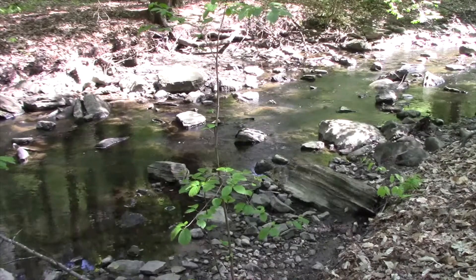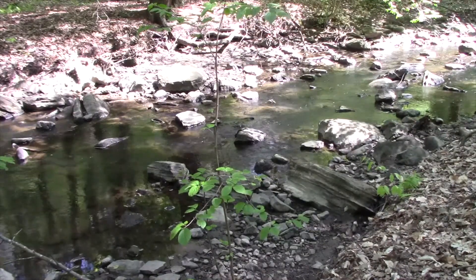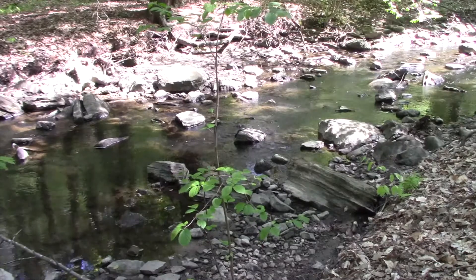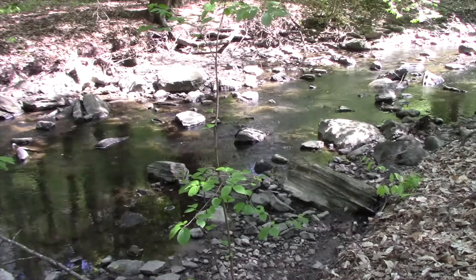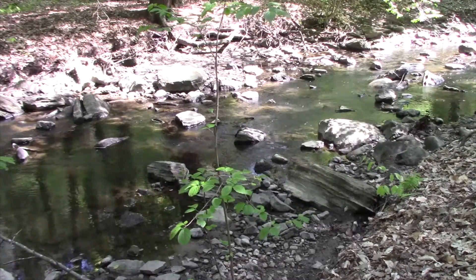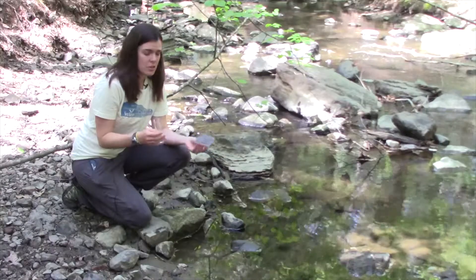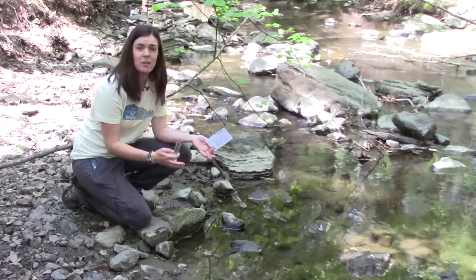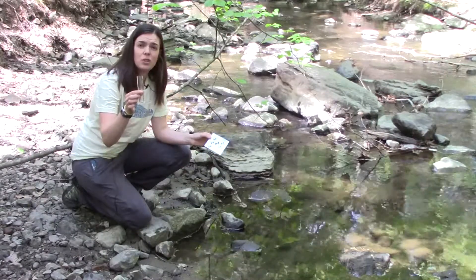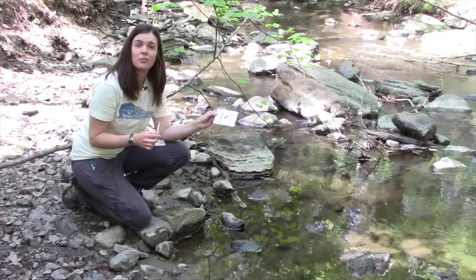Turbid water may be the result of soil erosion, urban runoff, algal blooms, and bottom sediment disturbances, which can be caused by boat traffic and abundant bottom feeders. So why would we measure this? We want to measure how much particle or sediment is in this water, and we've got our turbidity tube right here and a chart to compare that information.